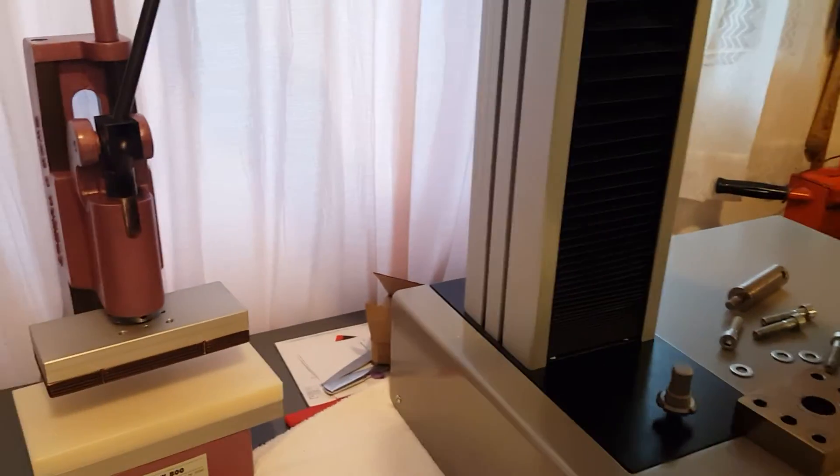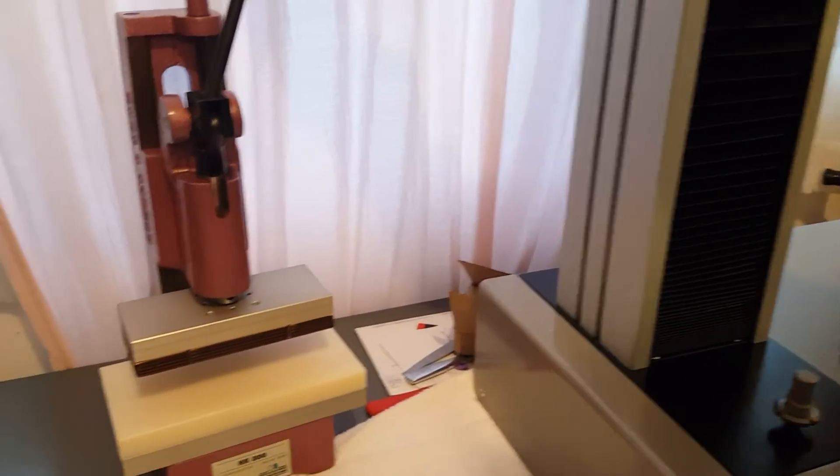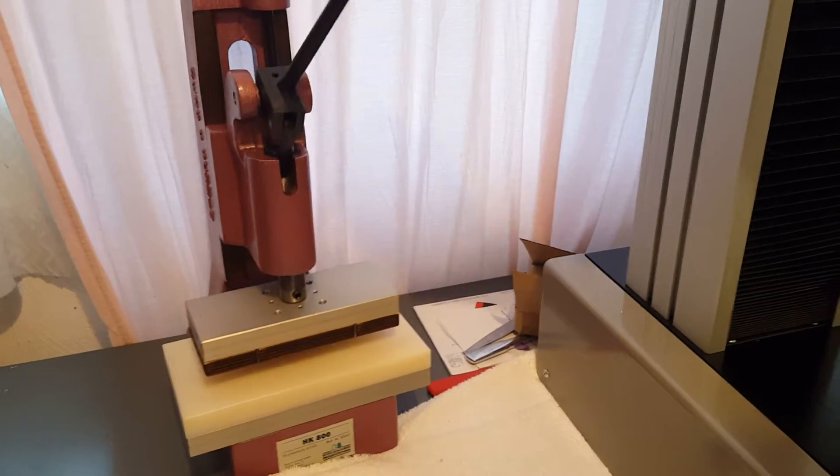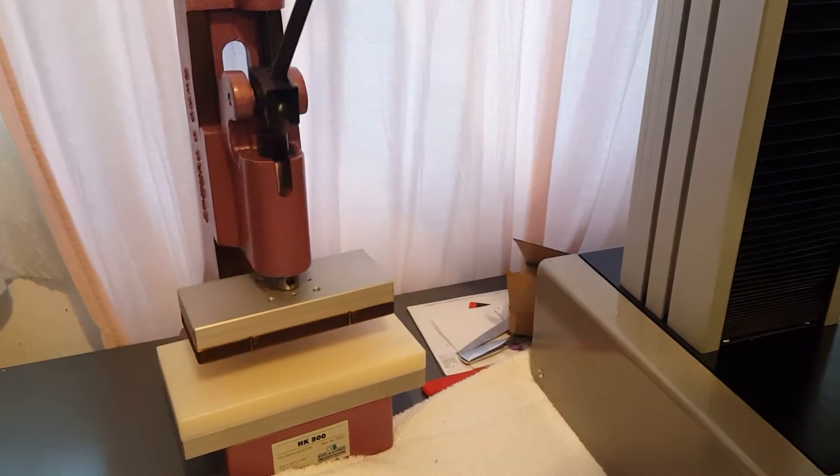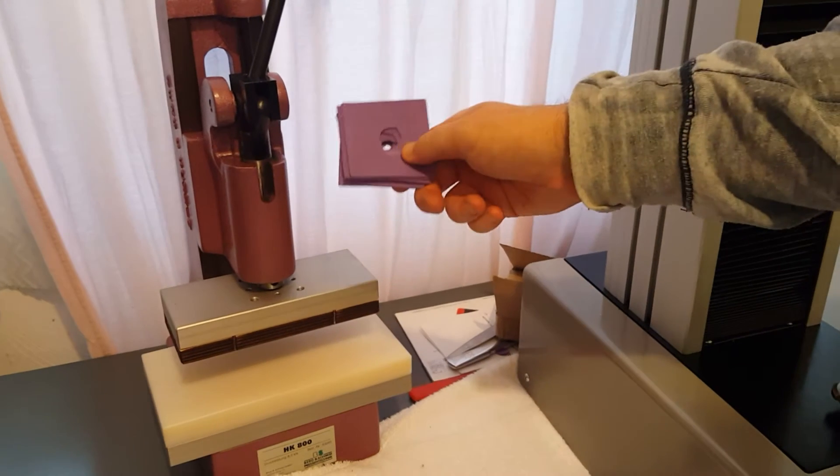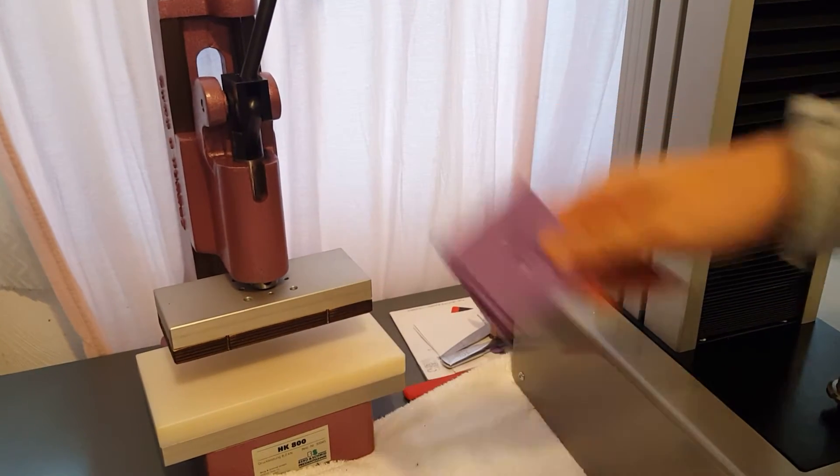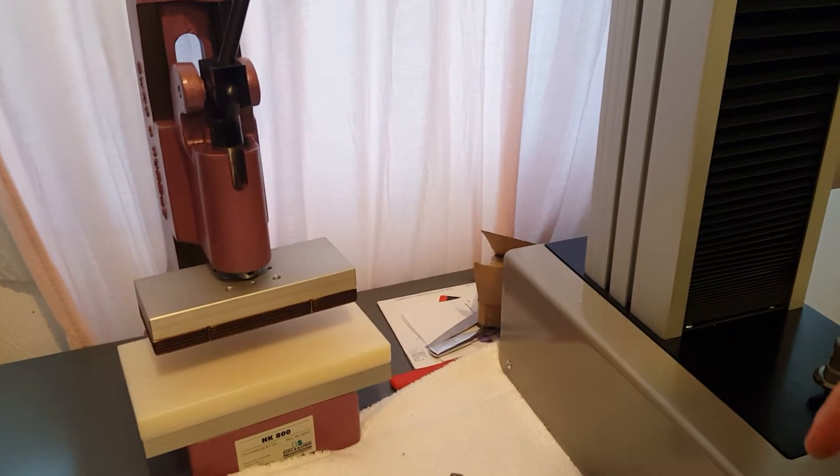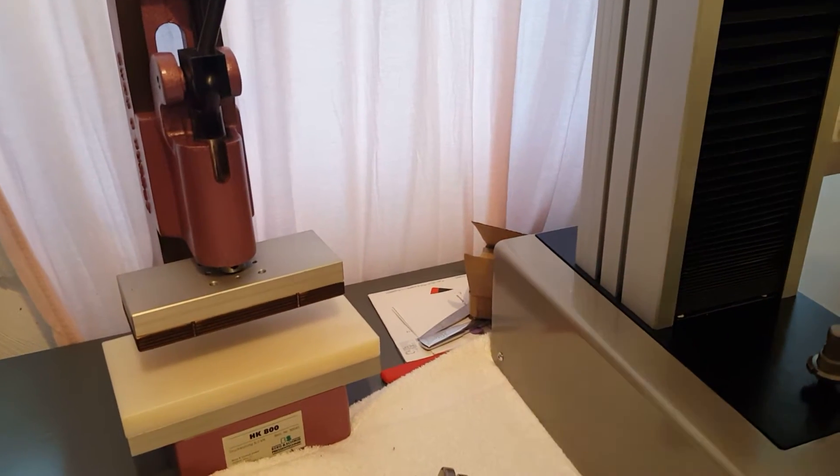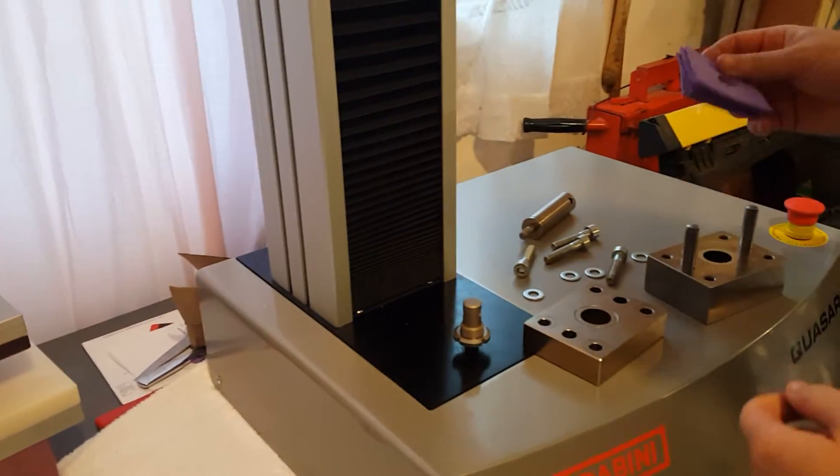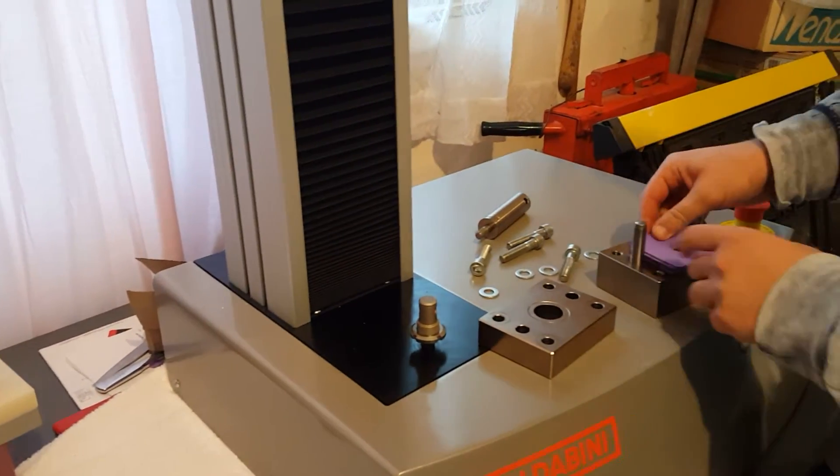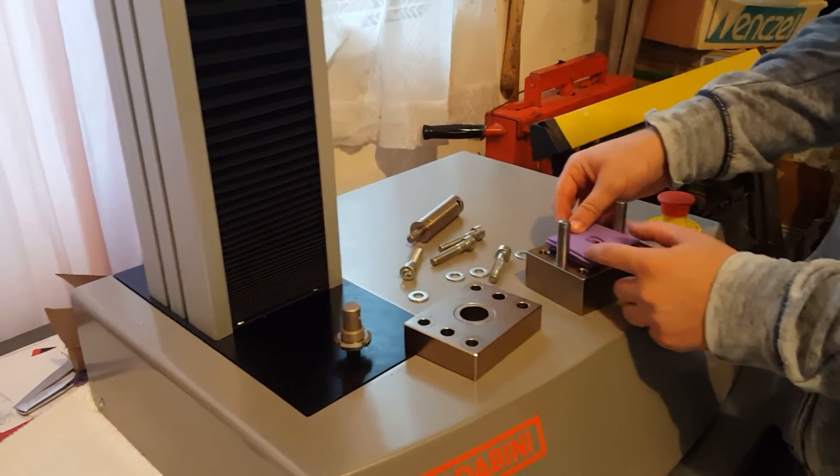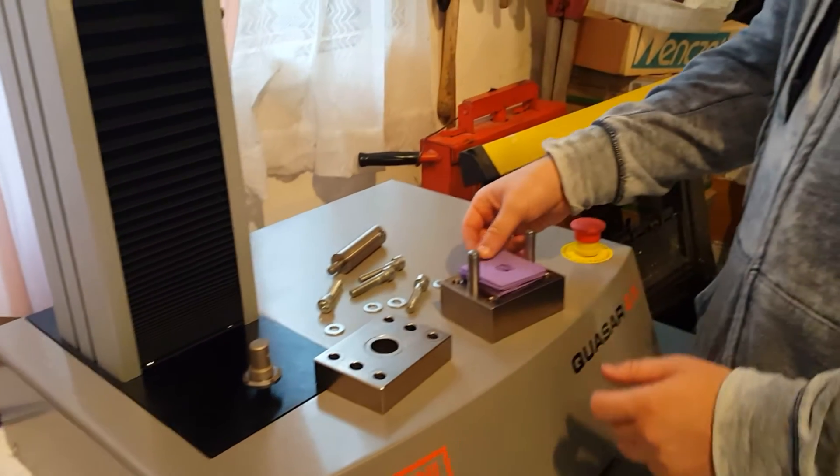We're going to start off by making our samples. We do that on an arbor press and cutting die. I already have our stack of five samples. These have the 11 millimeter hole in the center, so you can use either square or circular samples. Today we're using square. We're going to use a stack of five of these.